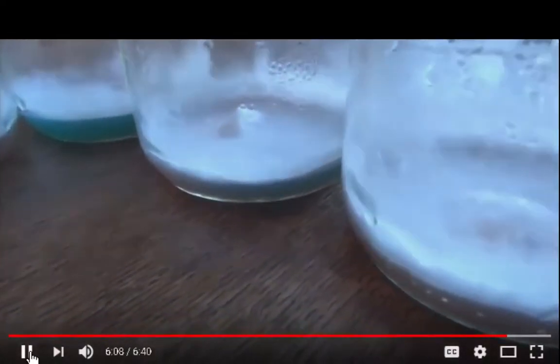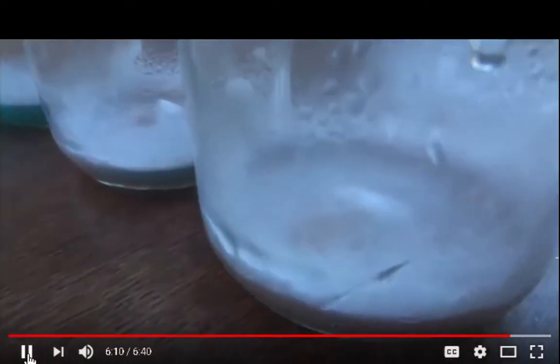I used malt extract agar, as I said, but if I'm going to do another generation, I'll mix it up and I'll add 1.7% honey. So it's 1.7% honey and 1.7% malt extract. This is because honey has a wide variety of nutrients and sugars. This means that the mycelium doesn't develop enzyme selectivity, meaning that it only eats malt extract.